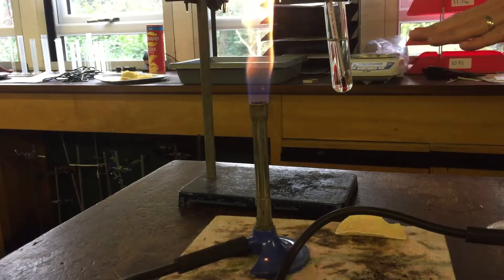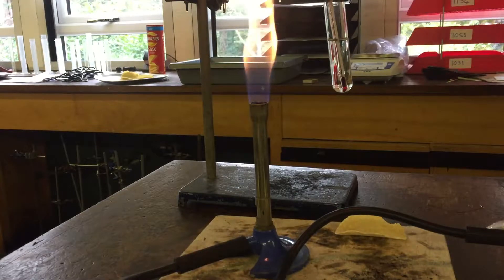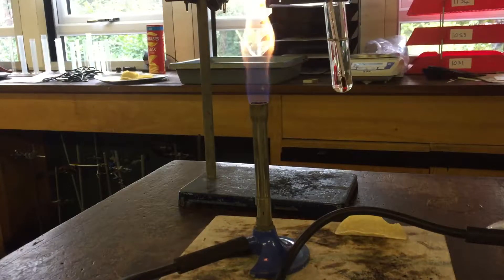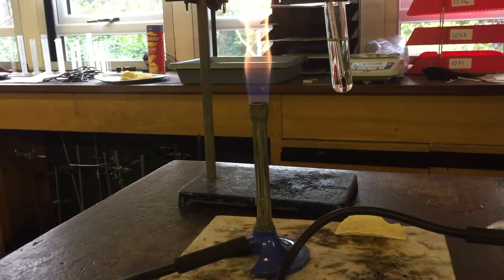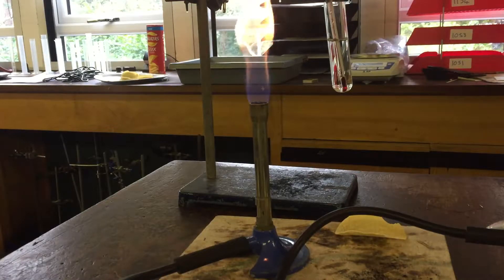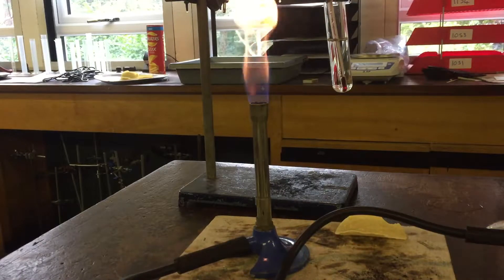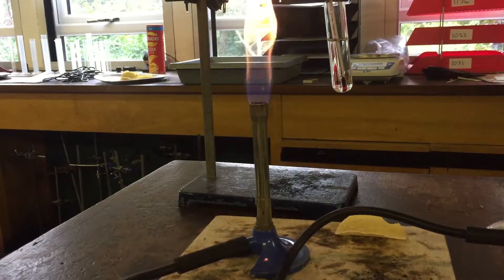We put 20 millilitres of water in the boiling tube. Our independent variable — the variable we're changing — is the type of crisp. Our dependent variable is going to be the temperature of the water.